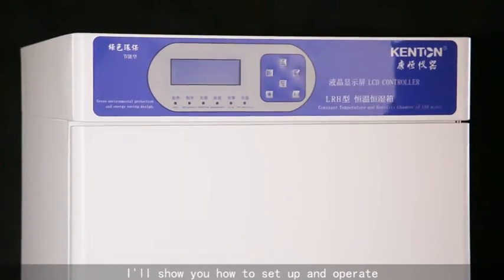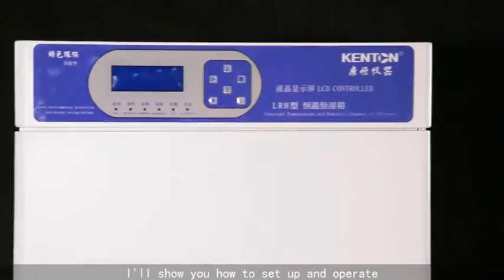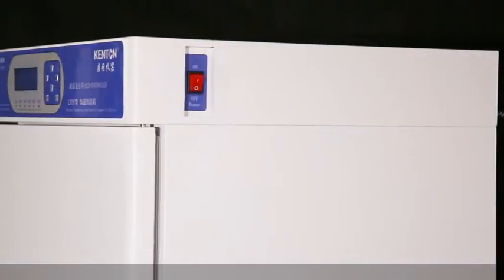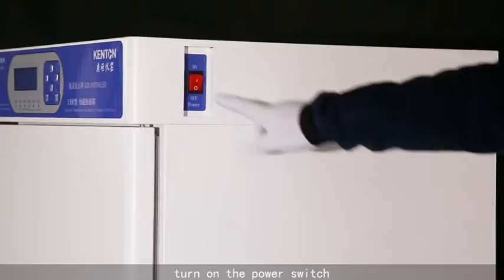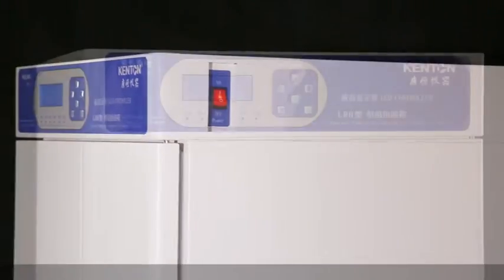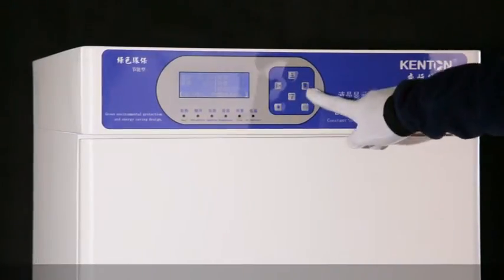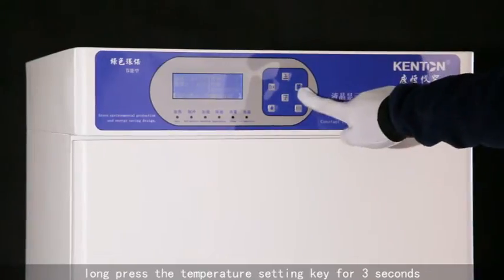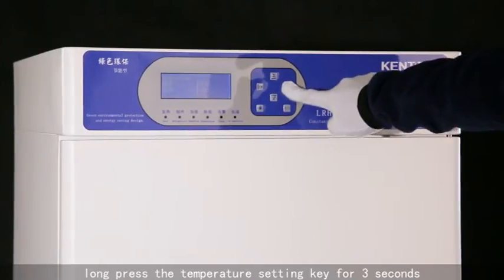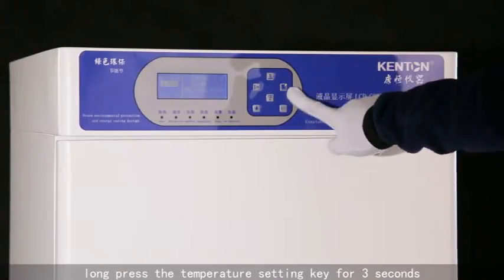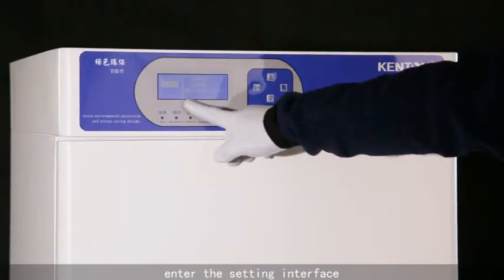I will show you how to set up and operate. Turn on the power switch. Long press the temperature setting key for 3 seconds. Enter the setting interface.